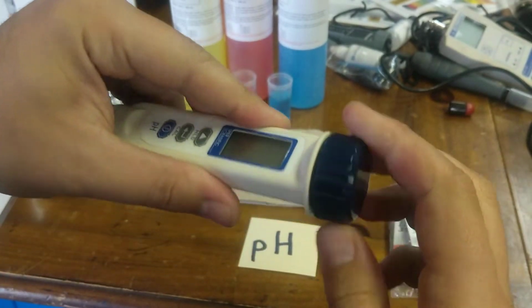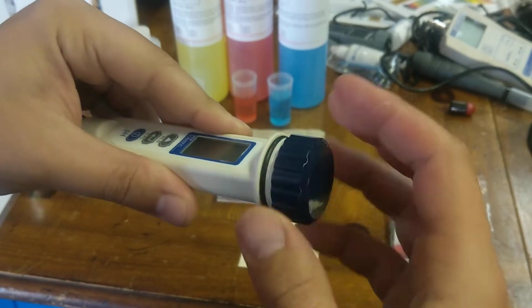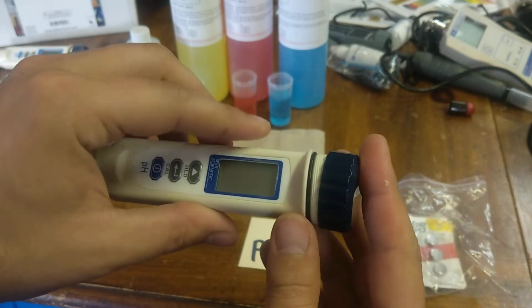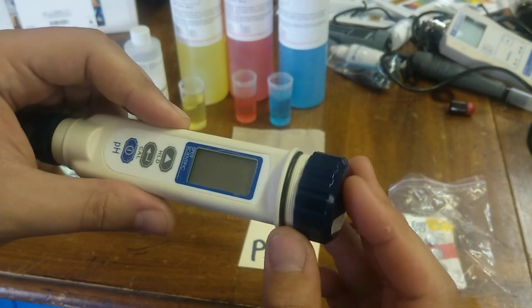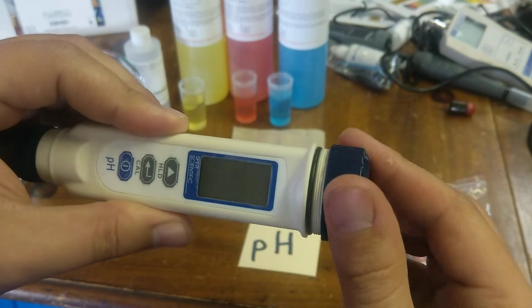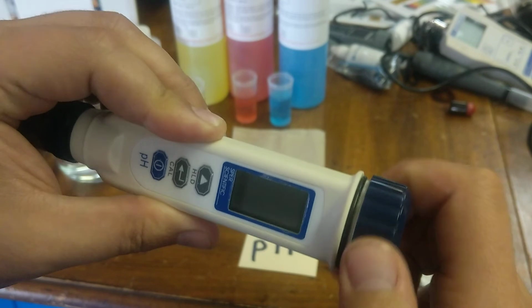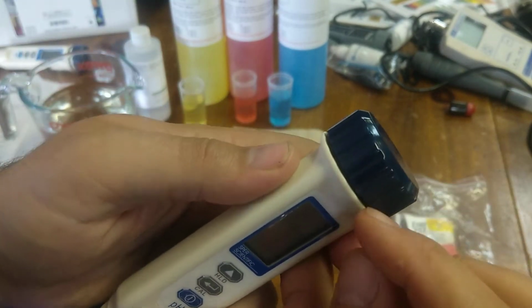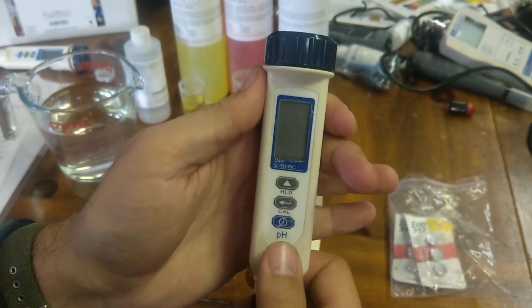In order to replace the batteries, you'll want to unscrew the top like so, and replace the batteries on the top. They are labeled the direction they should go. Make sure when you put the cap back on it's not canted, or else it will misthread. So I usually press it on so that's level. I'll sometimes back it out as well until it clips and then grabs on the threads, and then you can go all the way down to the O-ring. Make sure it's tight, not too tight, but tight enough that it makes a seal.